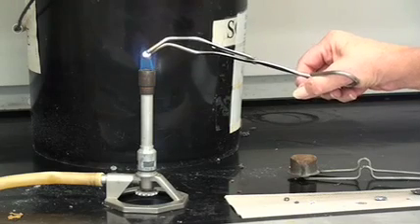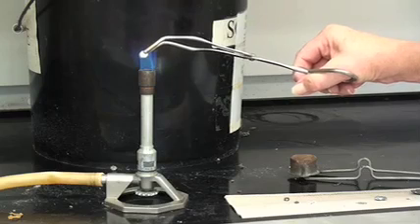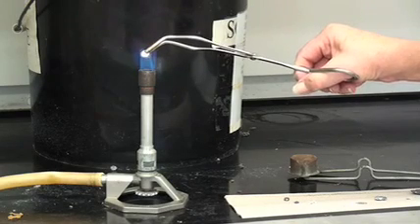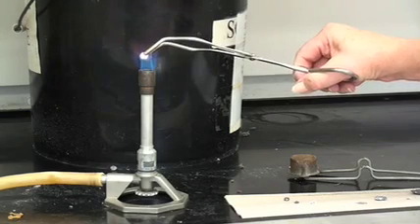It's not quite as shiny, but it looks like it's a little bit more luminescent, a little bit brighter in white color. Oh, we're starting to see some red color of it burning, but it's certainly not as flamboyant either as the magnesium or as the calcium.